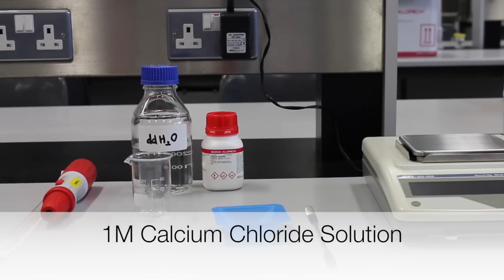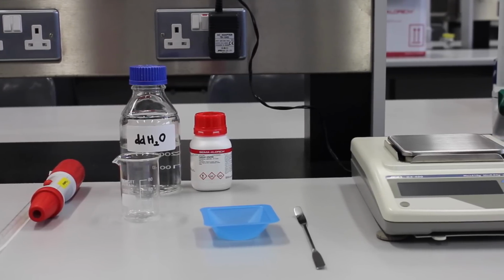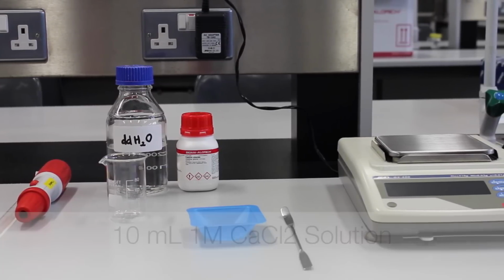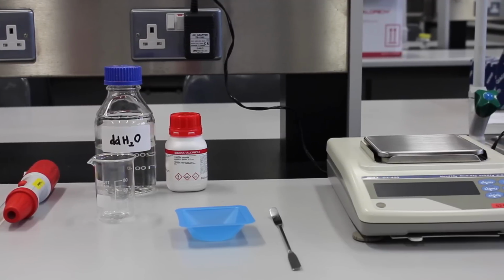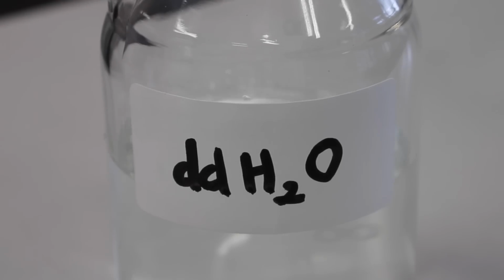Next, a 1 molar calcium chloride solution is prepared. Calcium chloride is used to make E. coli cells competent. In this video, 10 milliliters of 1 molar calcium chloride solution is prepared. To make calcium chloride solution, the following are needed: calcium chloride and water.